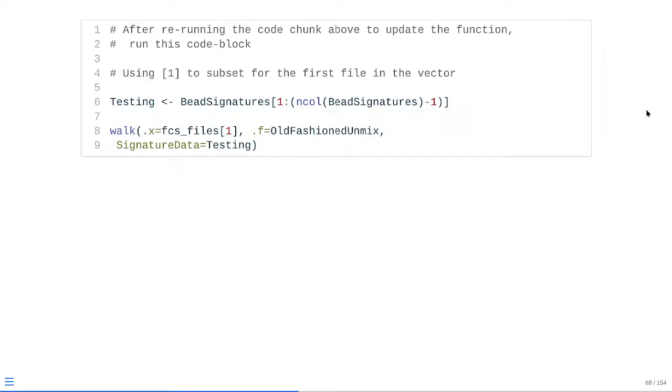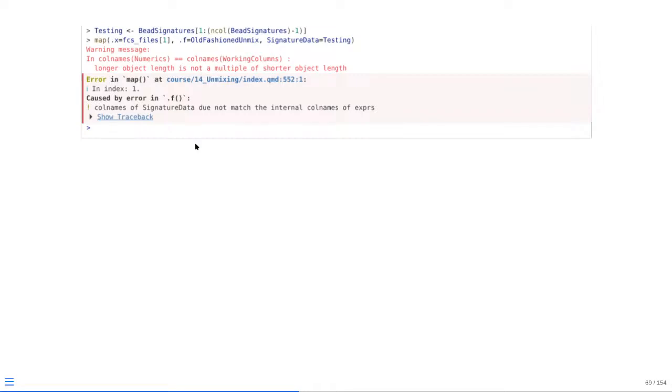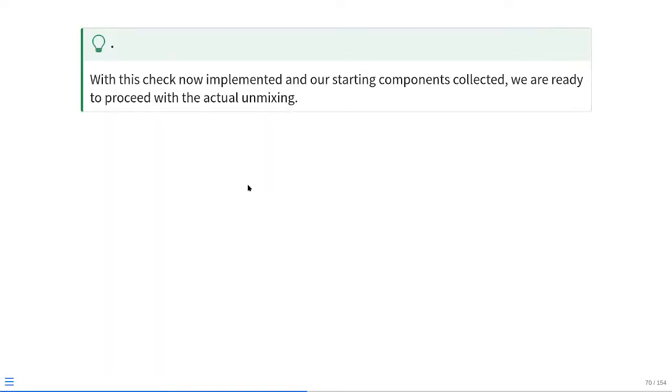So if we actually run the code, you'll see we get back an error that looks something like this. That way, rather than a little silent error that doesn't explain what's going on, like I'm still having extra numeric columns that shouldn't be there, or I'm trying to unmix this with something that was acquired on a different instrument, at least you have some idea of what's going on before you move too far into the process. So with this check now implemented and our starting components collected, we are ready to proceed with the actual unmixing. And let me take a sip of coffee.